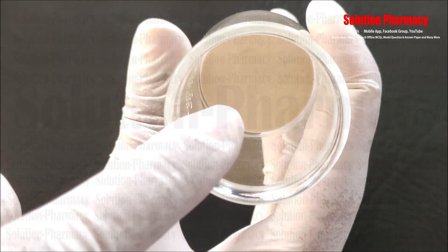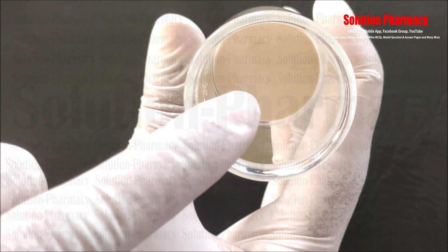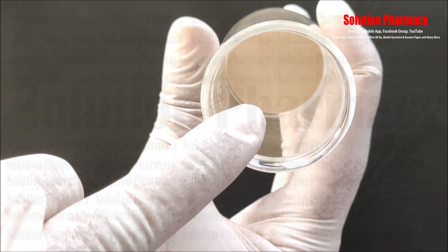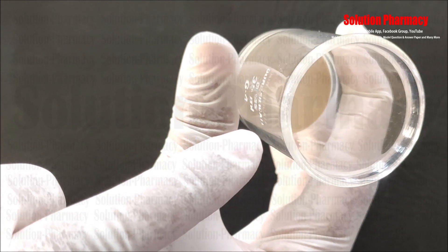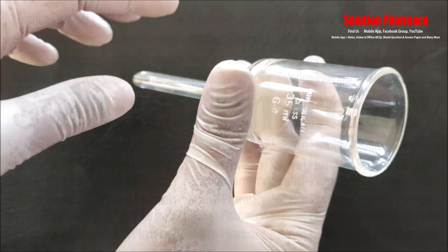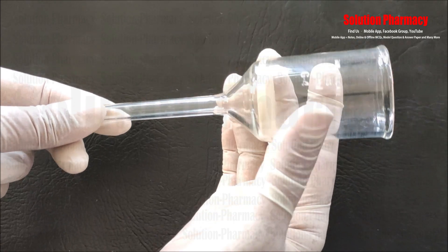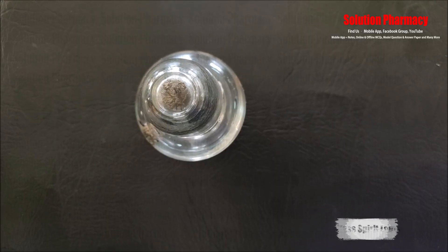The sintered glass disc is made by sintering together glass particles into a porous solid, through which gas or liquid may pass. It is also called a fritted glass filter, used to filter out very fine solid particles, precipitate, or residue from a fluid. Due to its very small pore size, it is also used to prepare sterile solutions by filtering out fungi, bacteria, or other contaminants.